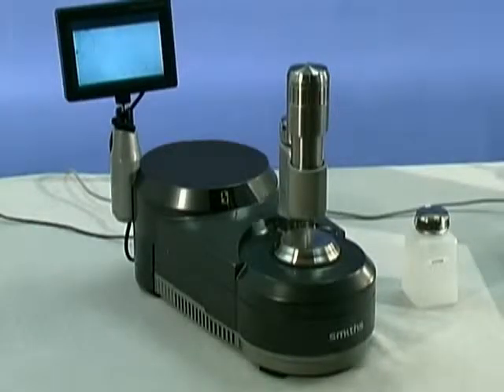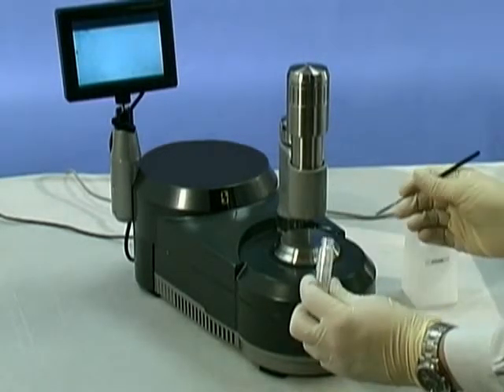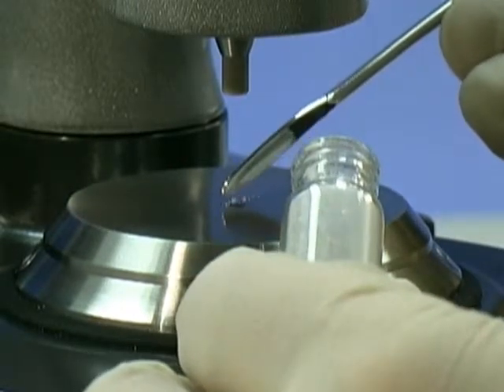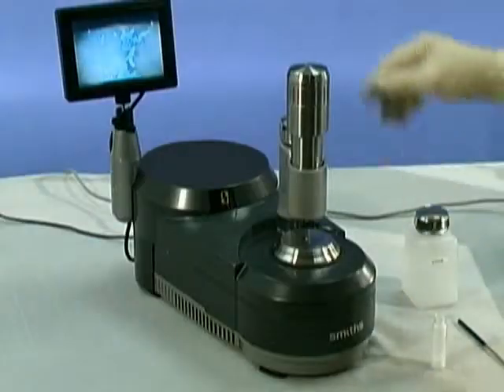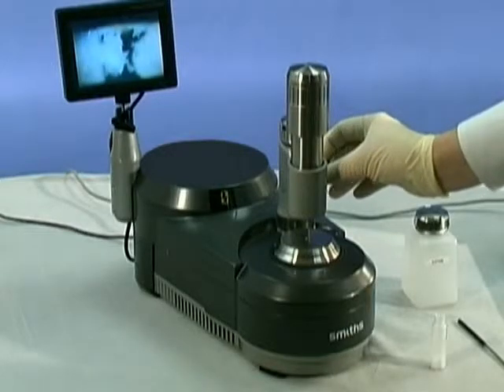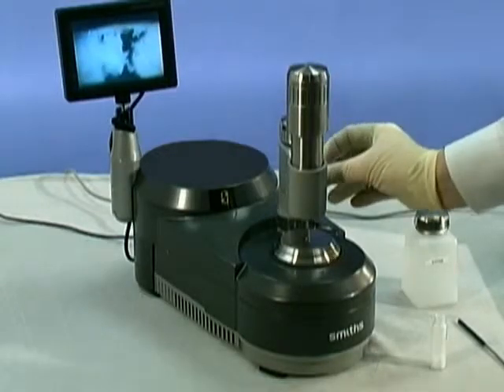At this point we are ready to add a sample to the diamond. In this case we are going to analyze a simple powder sample, and we only need a small amount to perform analysis. We place a few grains of the powder, which we can see appearing on the monitor. We can adjust the camera illumination to either give us a dark field view, in which this white powder shows up on a black or dark background, or we can use the bright field illumination in which the sample appears as dark on a light background.